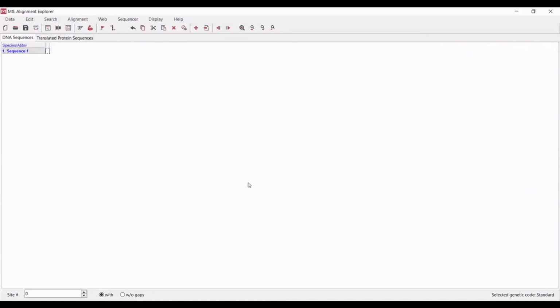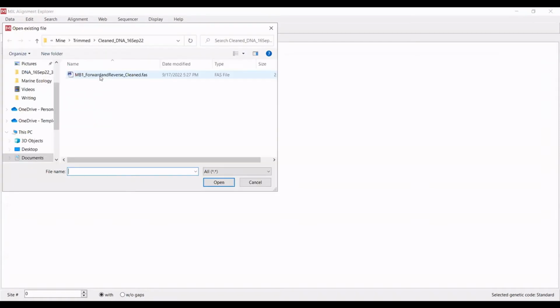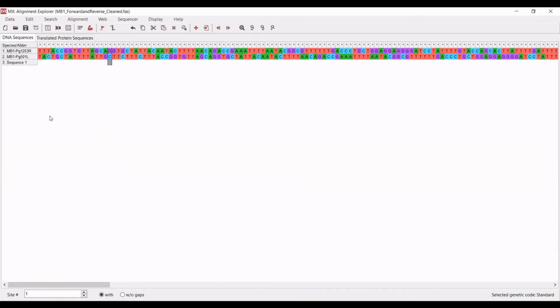It's just truly a blank alignment. There's nothing in here at all. And so what you want to do is at the top, under Edit, you want to insert sequence from file. And so this is the cleaned sequence file from BioEdit. When you go to BioEdit and you hit Save As, after you're done editing everything, it automatically saves as a FASTA file, which is readable by a number of different programs. And so I'm going to select this FASTA file. I'm going to open it here.